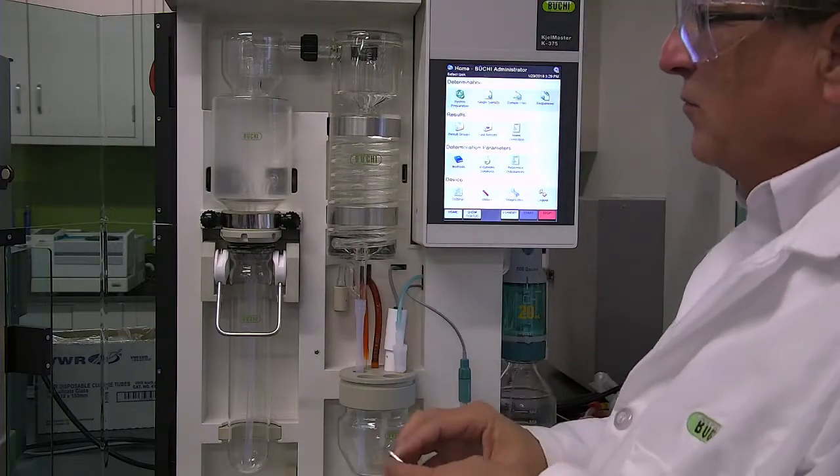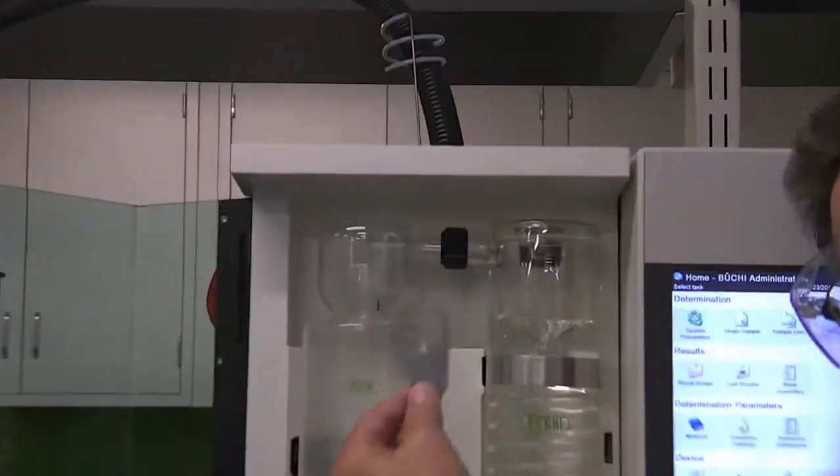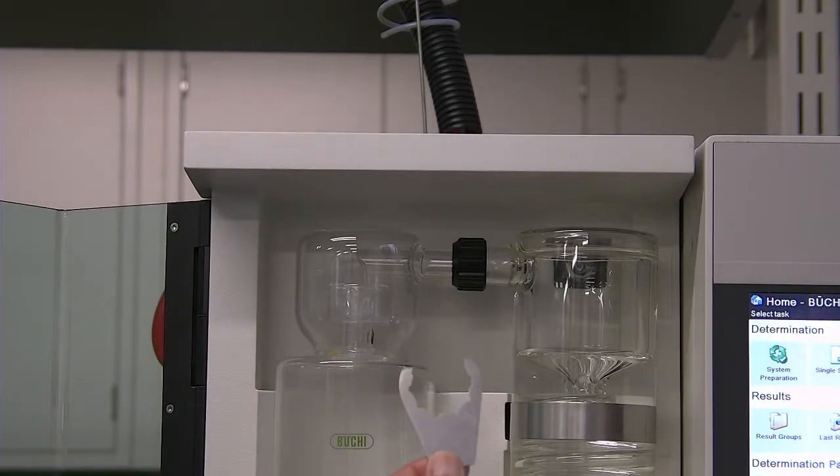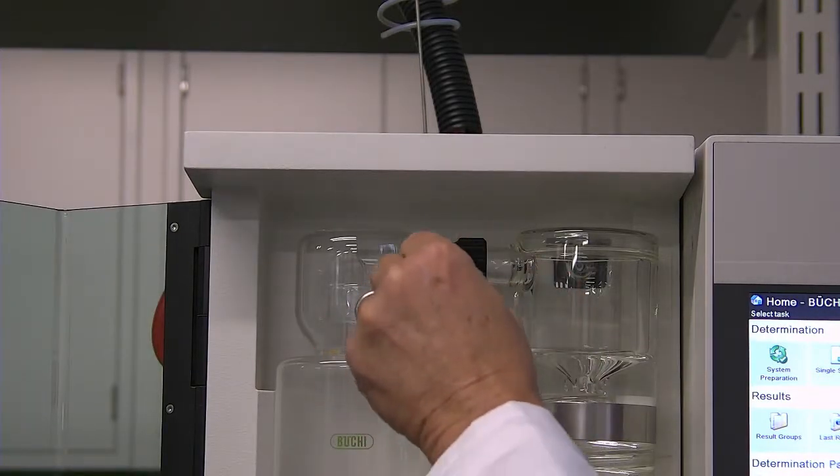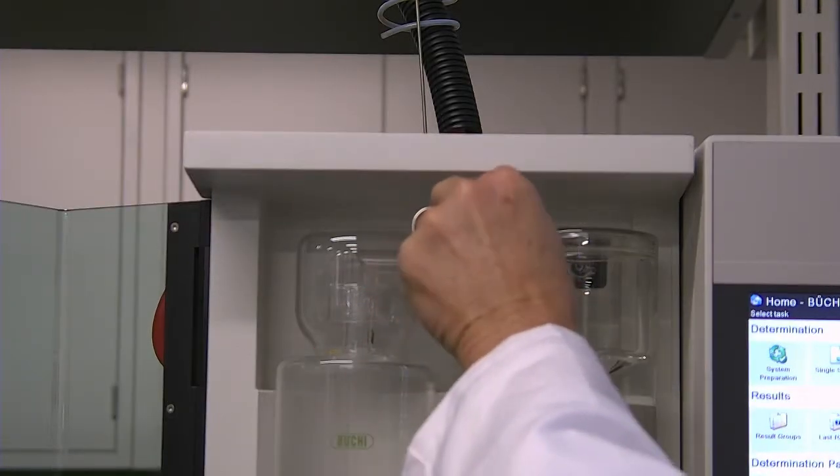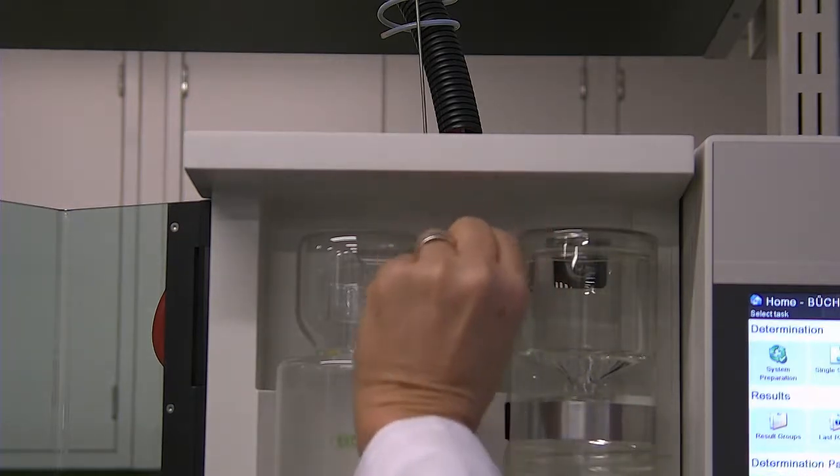To remedy that, always use the tool for tightening. This is a very simple tool that goes right on there and tighten that down.